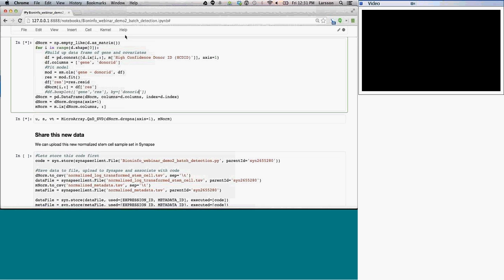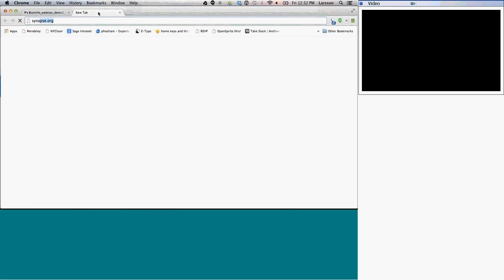In the meanwhile, I can go over to Synapse and show you what the data set looks like and what we're extracting. So we'll pull up an instance of Synapse over here. I meant to do this earlier, actually, when we're fetching the expression data and what it looks like when we're fetching that.